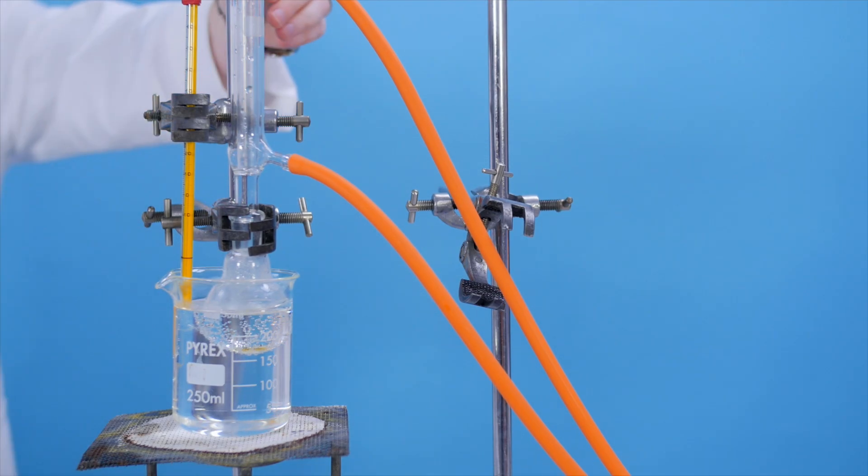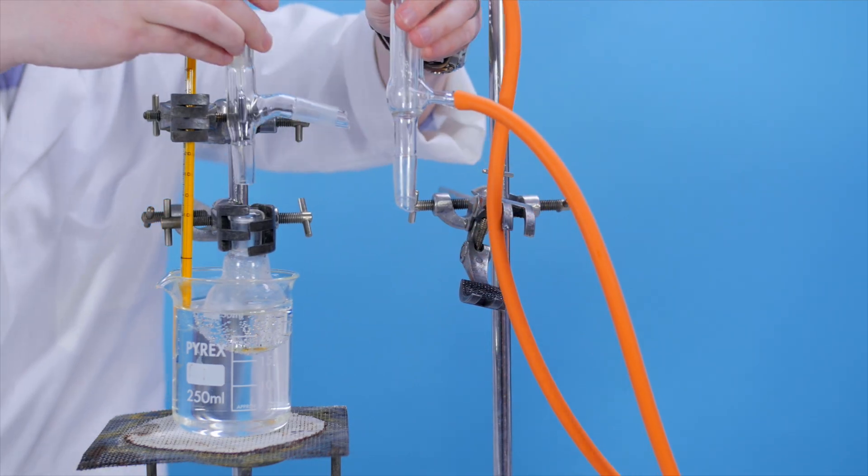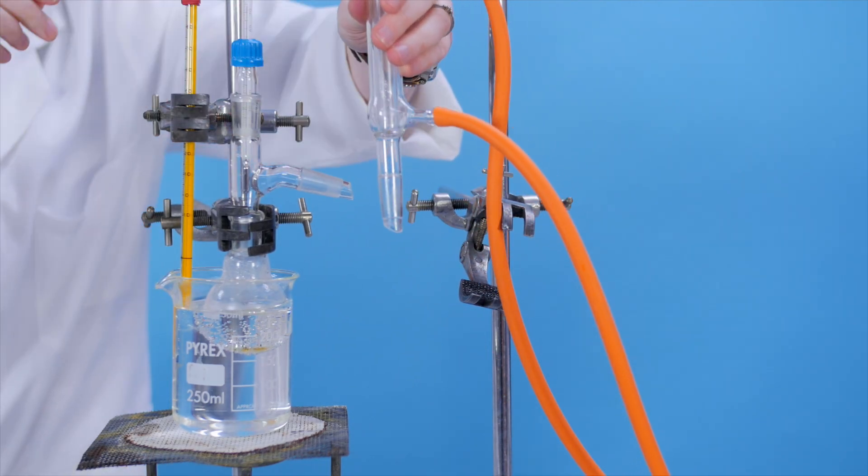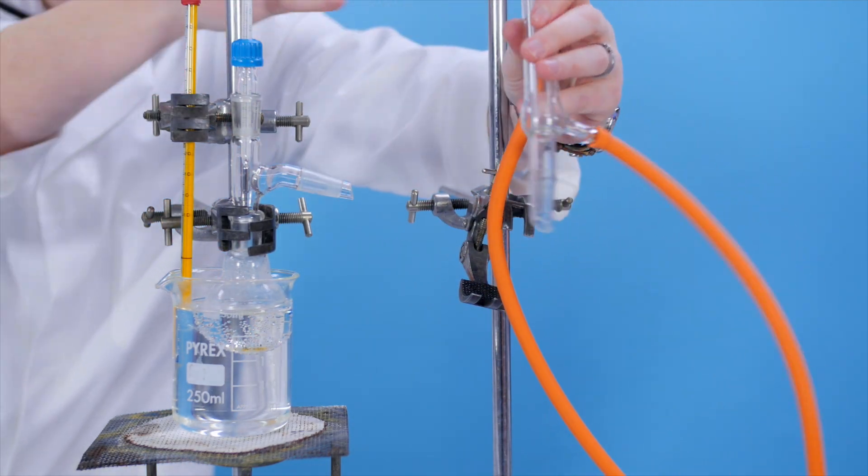The reaction is complete after about 15 minutes. After this time, rearrange the apparatus to distill the product from the reaction mixture.